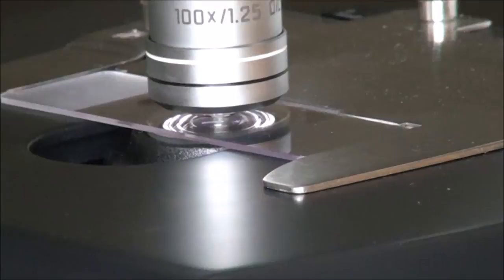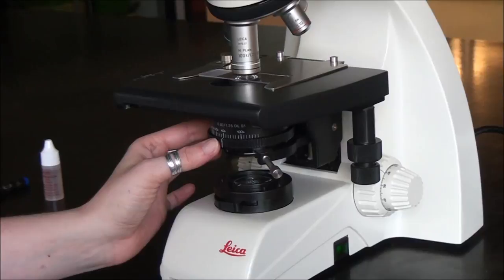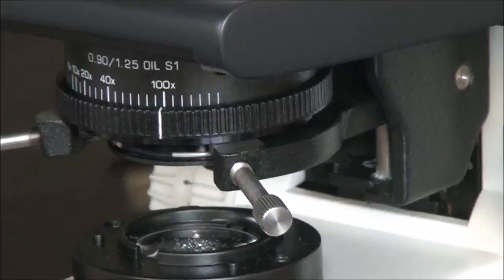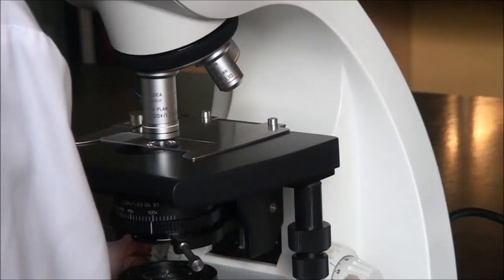One final adjustment: we have to come back to the aperture diaphragm and adjust it to 100. So the 100x objective oil immersion lens, 100 for our aperture. Looking through our ocular lenses again, you might not see anything. This can be a difficult step. It's really important to just make fine focus adjustments.